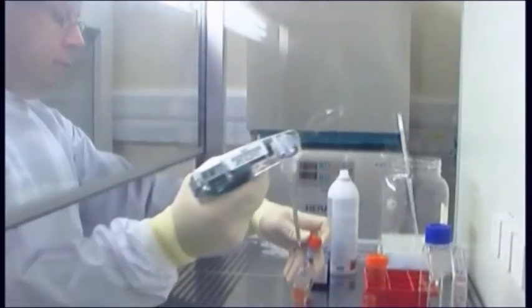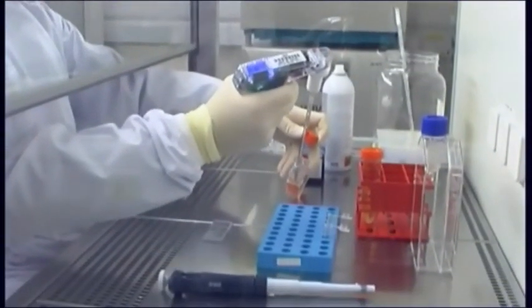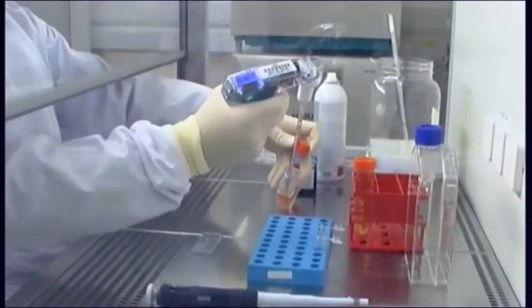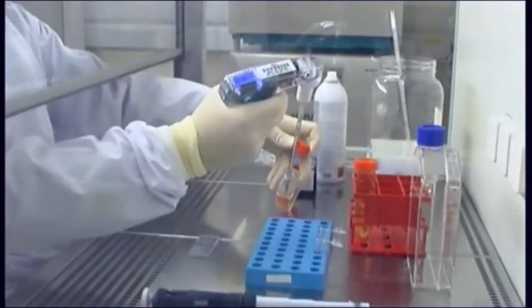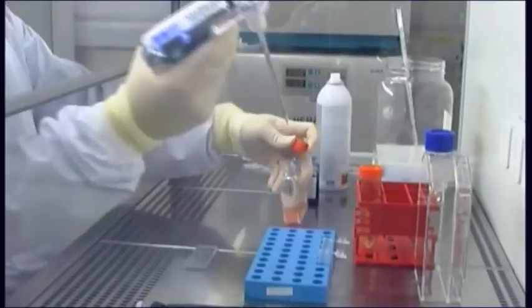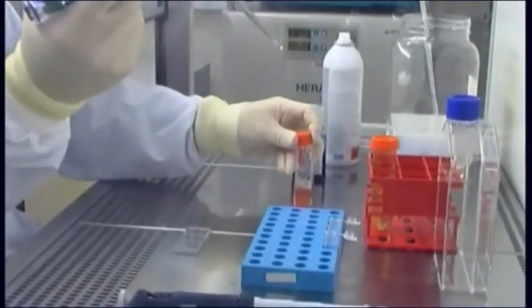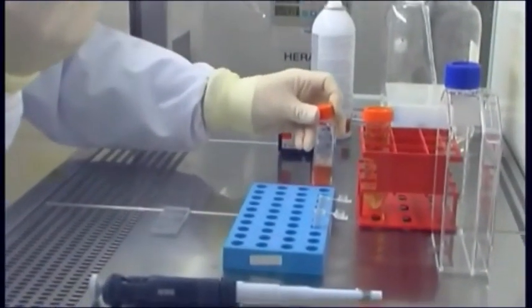Under sterile conditions, remove a sample of the culture. Add 100 to 200 microliters of this sample to a microtube.